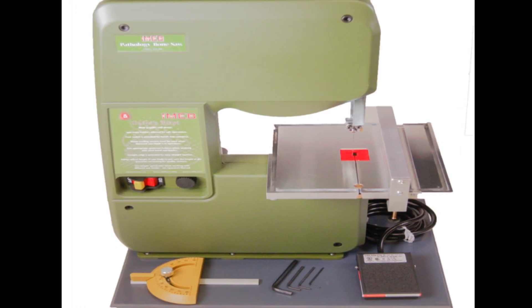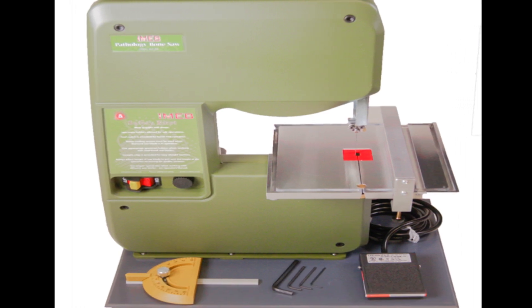The IMEB bone bandsaw video tutorial: a step-by-step guide on how to operate the bone bandsaw.